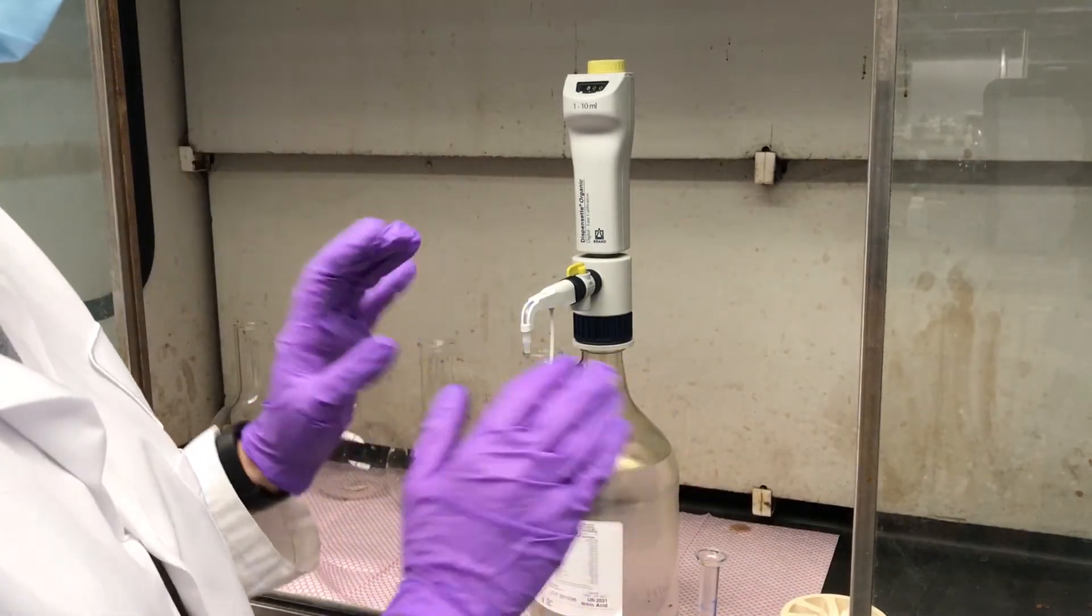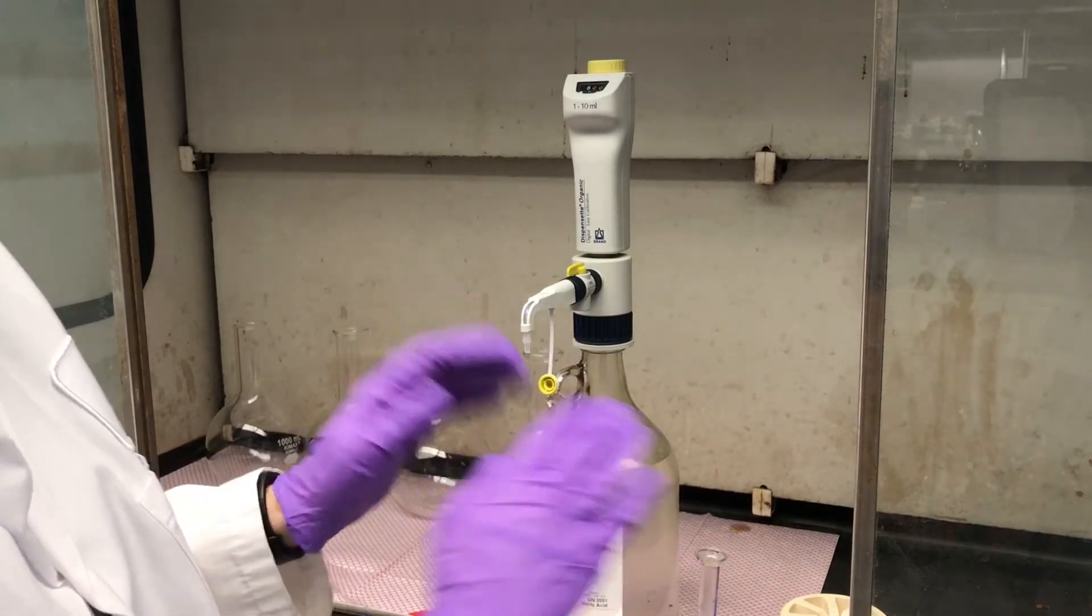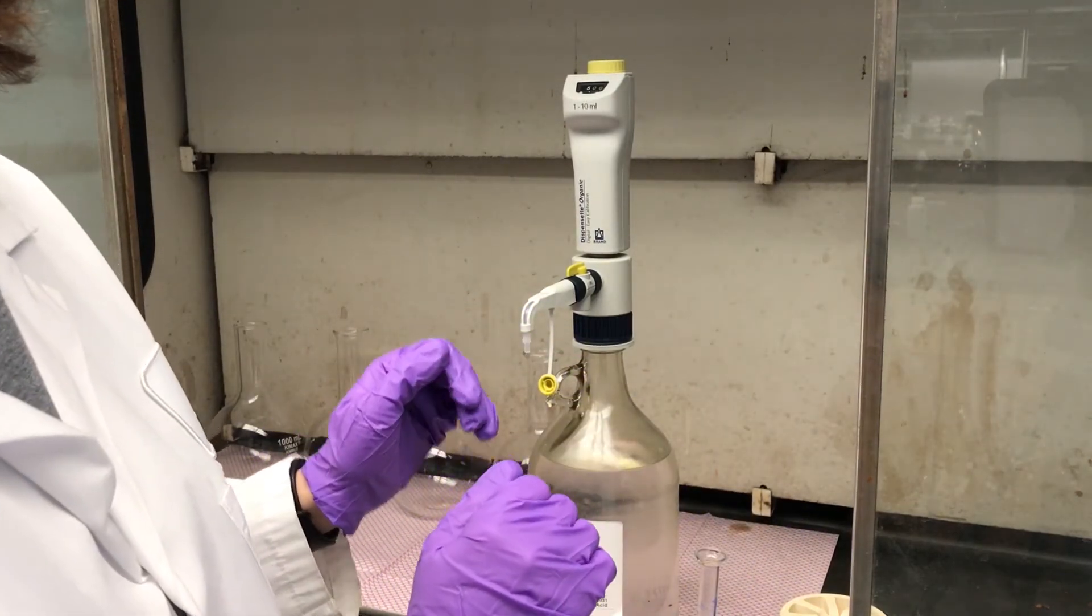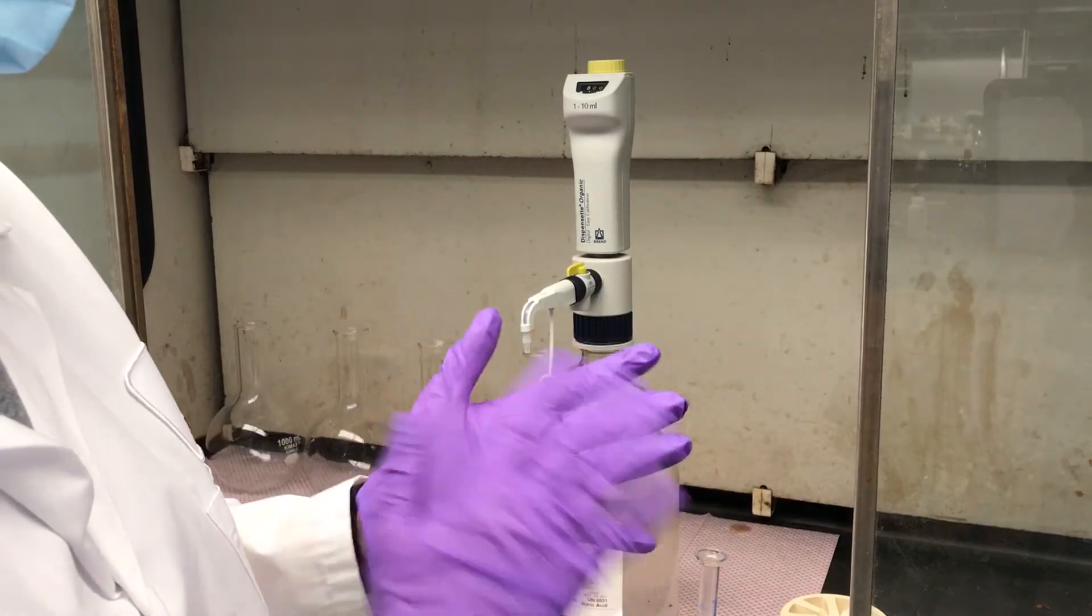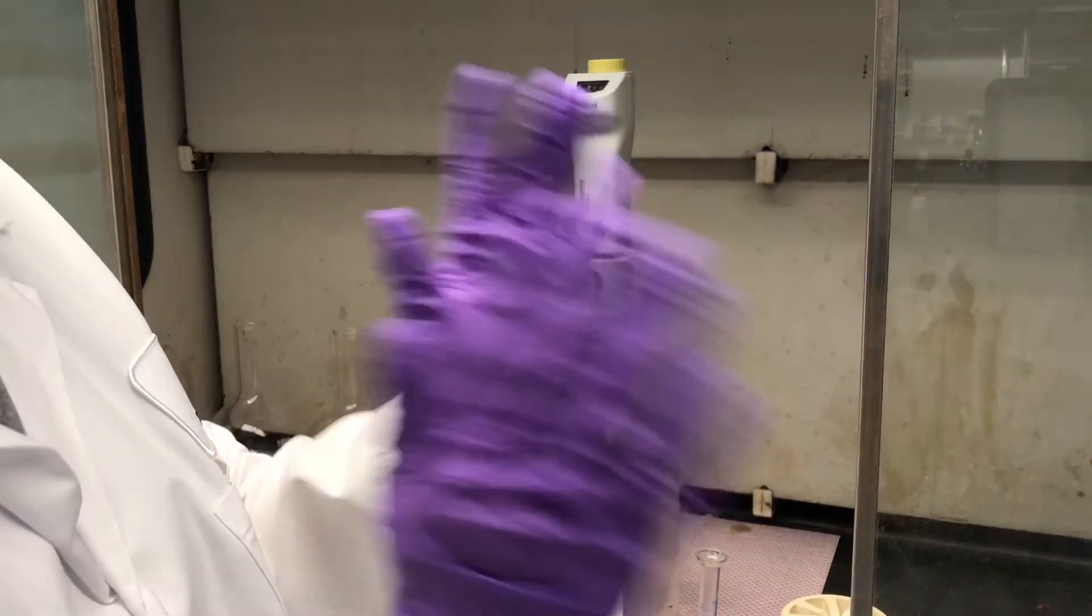As soon as you're done dispensing the acid, when you're done putting the PTFE liner in the digestion box, you're done with the acid, take off your gloves.